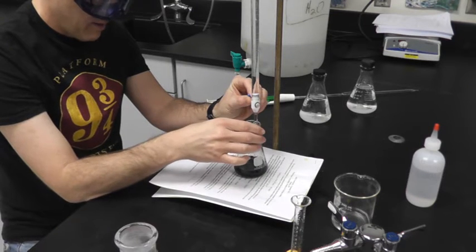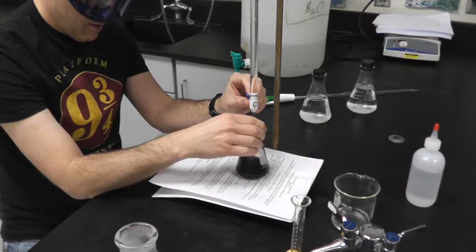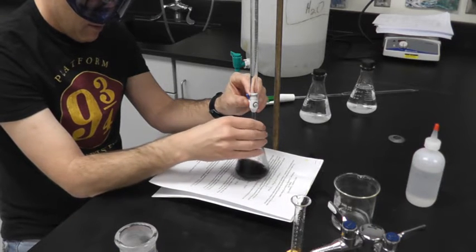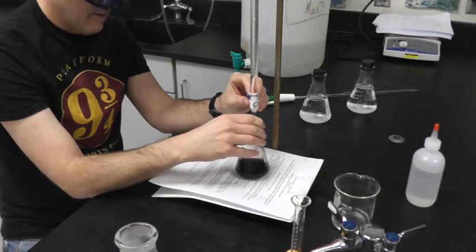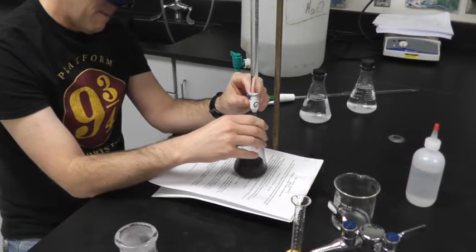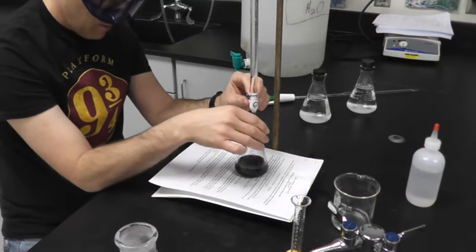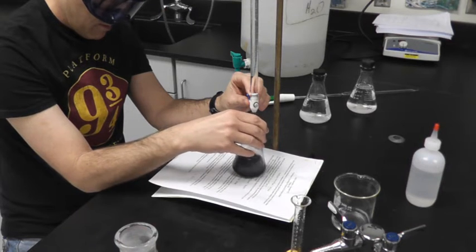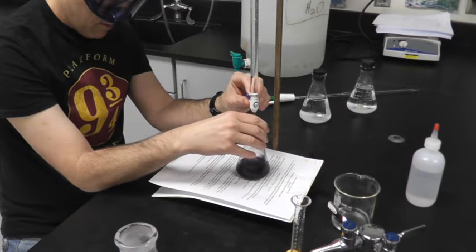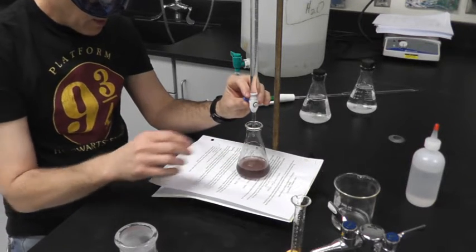I'm going to go drop, drop. And that's probably it.